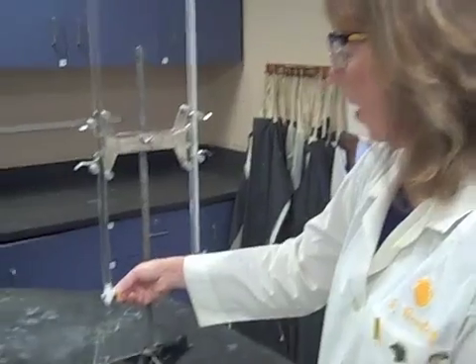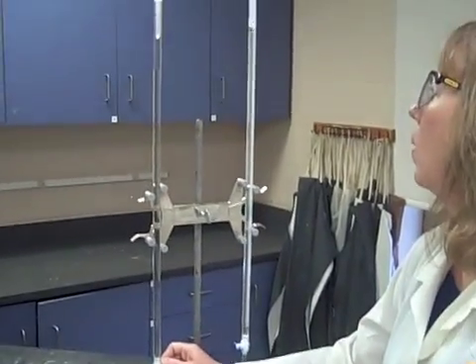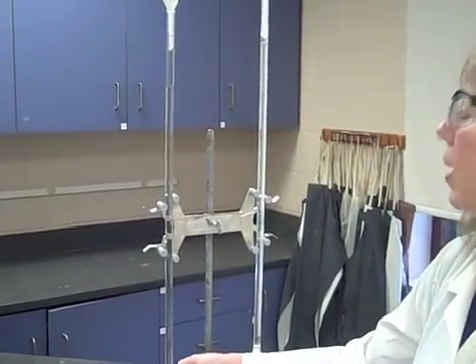So here we go. I'm going to open up the stopcock. I'm letting it fly. I was somewhere around one. I decided to stop at around six.